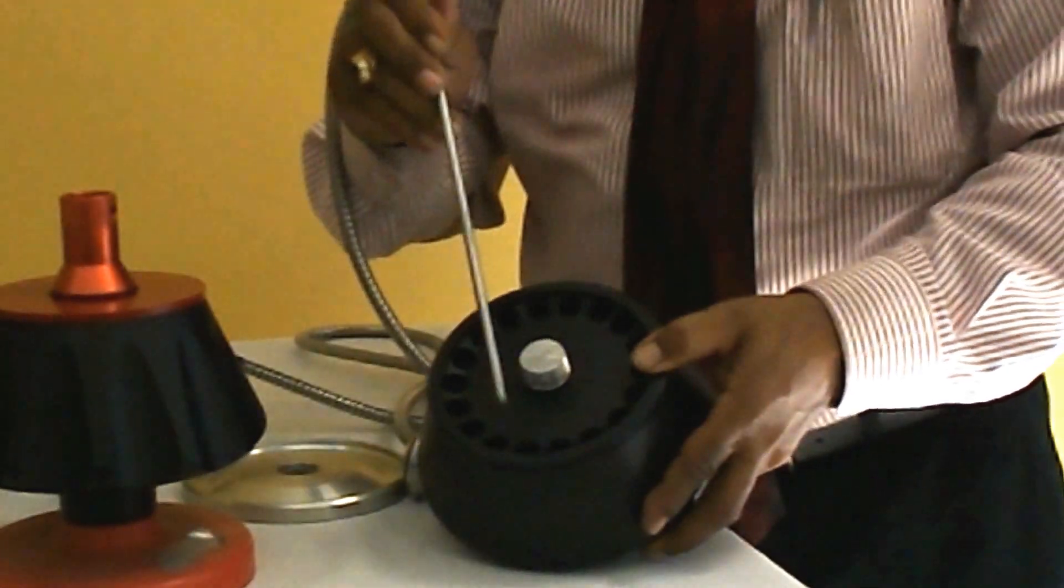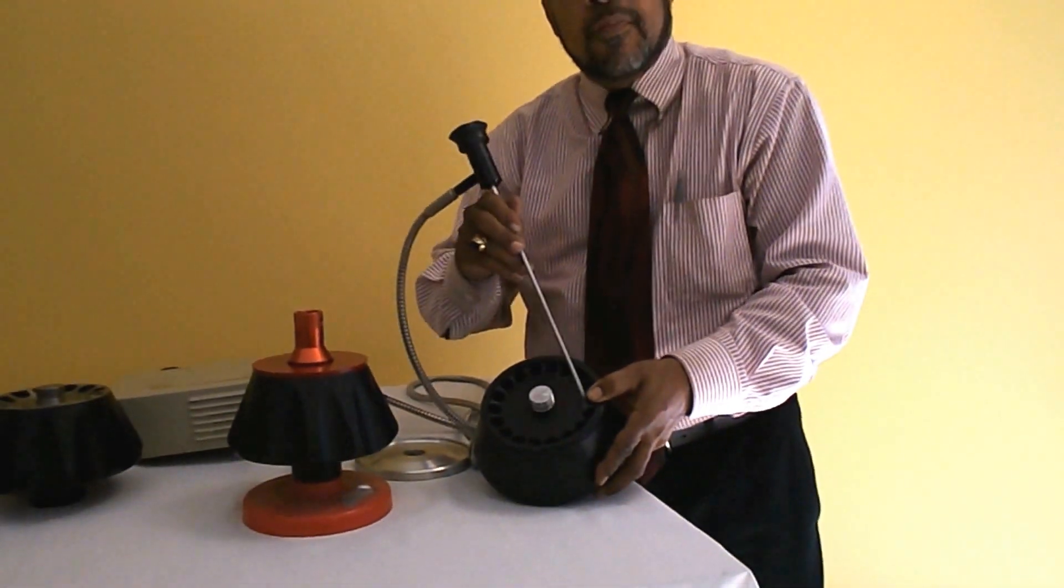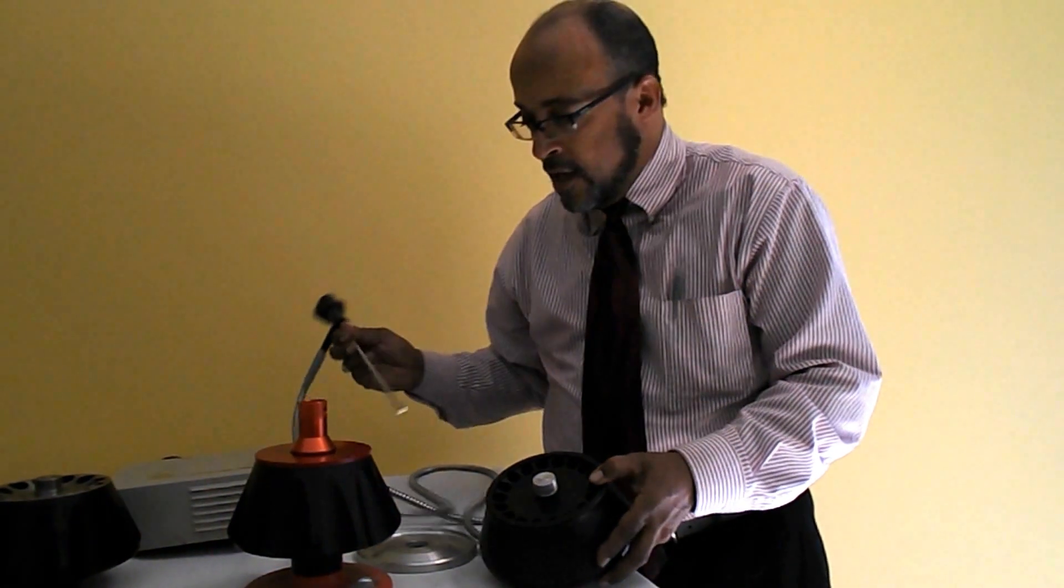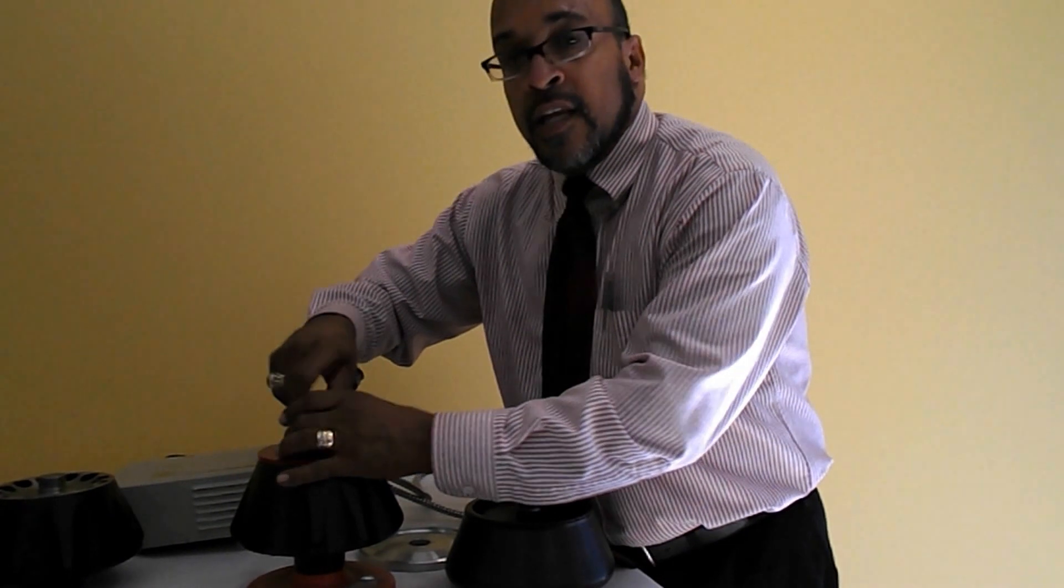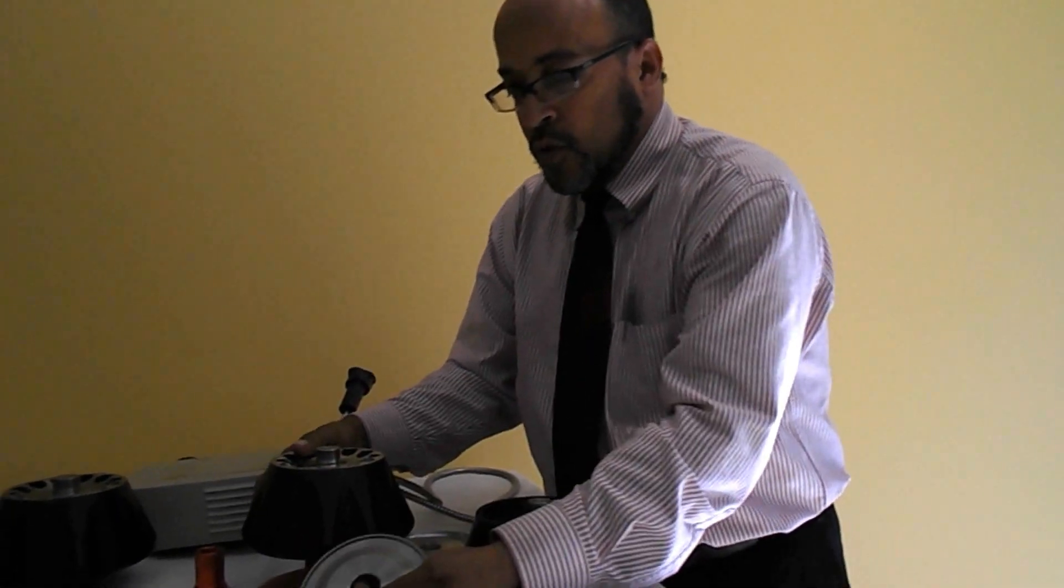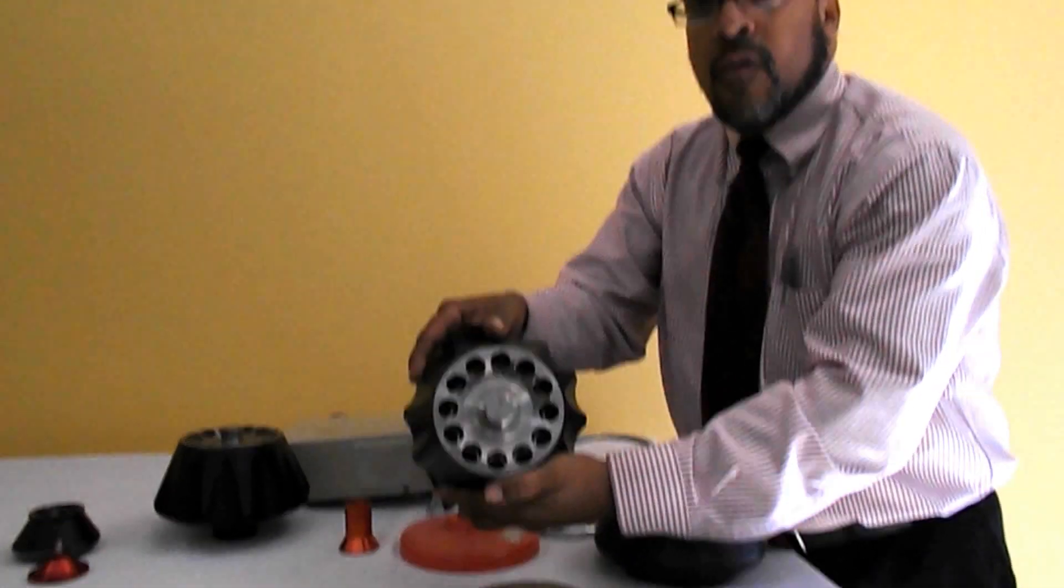Very important. With aluminum based rotor you will see that all of this is black on the inside, in comparison to a titanium rotor which is all gray.